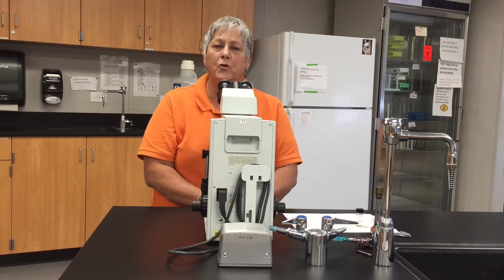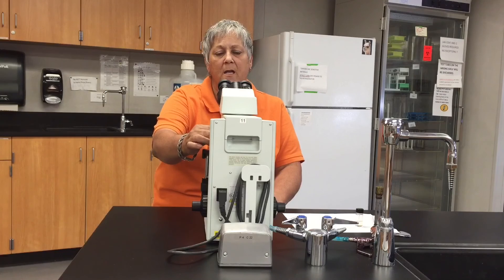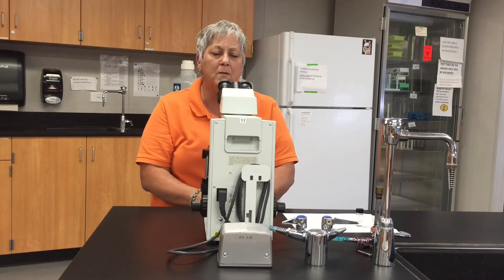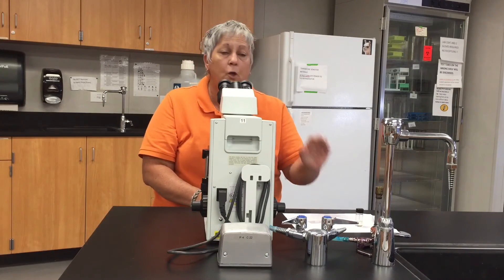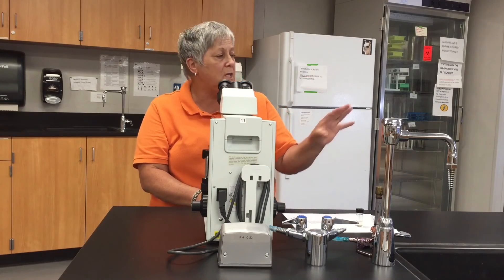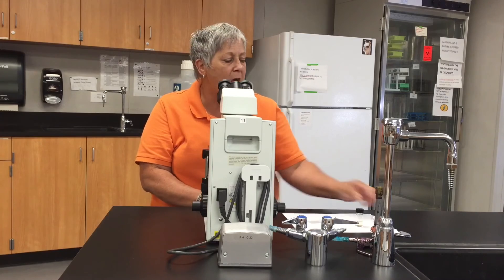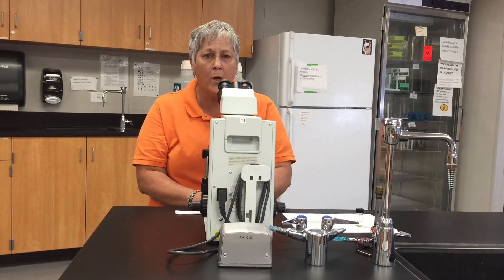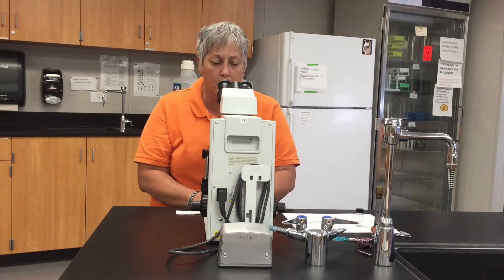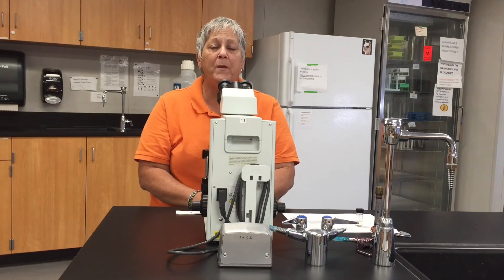Once you're done making your observations, swivel the revolving nosepiece until the scanning lens is in place and remove the slide. You can use the lab wipes to clean all of the oil off the slide, and then use your lens paper to thoroughly remove the oil from the oil immersion lens. Happy microscopy — I'll see you in class!